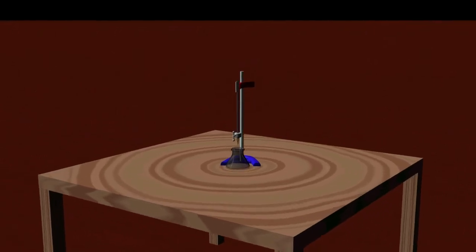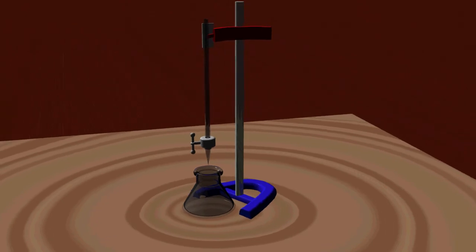This is how you set up the experiment. Take a stand, an Erlenmeyer flask, a burette and a clamp.